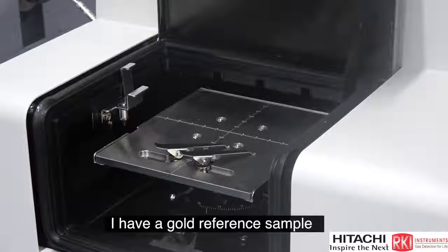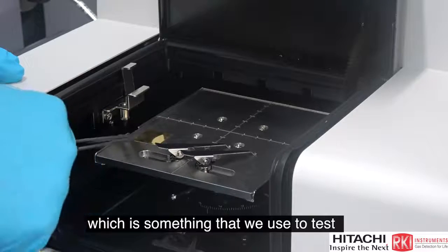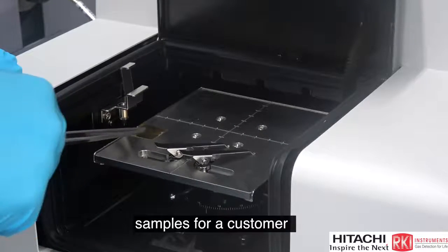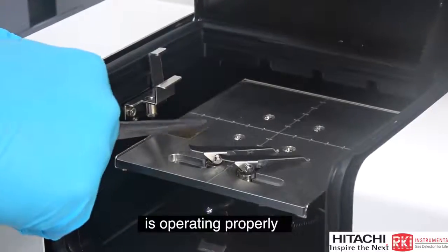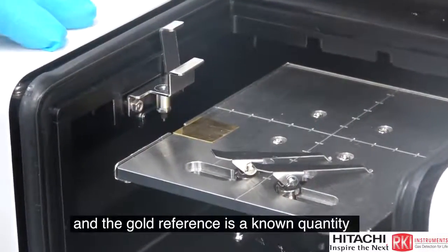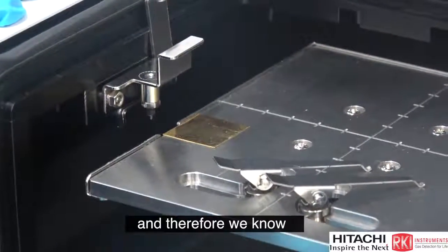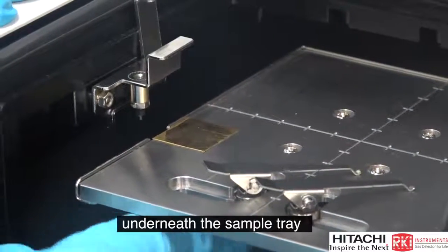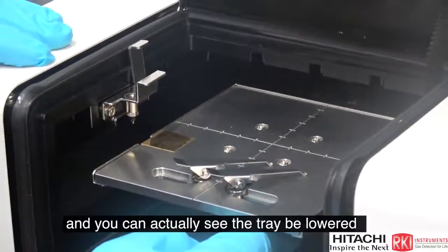I have a gold reference sample, which is something that we use to test the AC2 before we run any actual samples for a customer. Basically, we want to make sure the AC2 is operating properly, and the gold reference is a known quantity where we know what the work function range is likely to be, and therefore we know if we're getting valid readings or not. There's a little adjustment wheel underneath this sample tray, which I'm going to move, and you can actually see the tray being lowered.